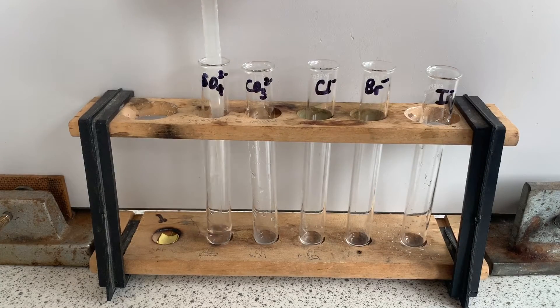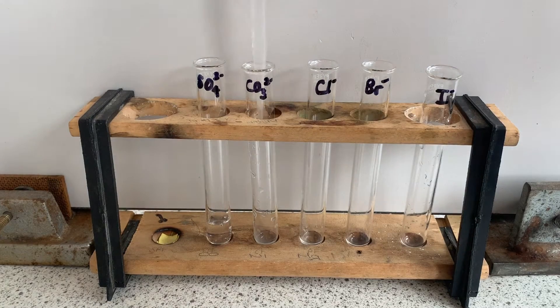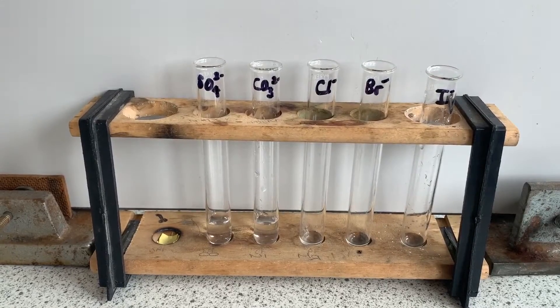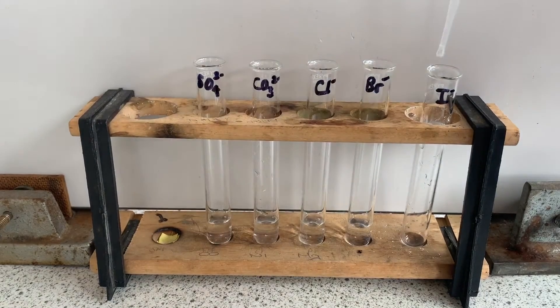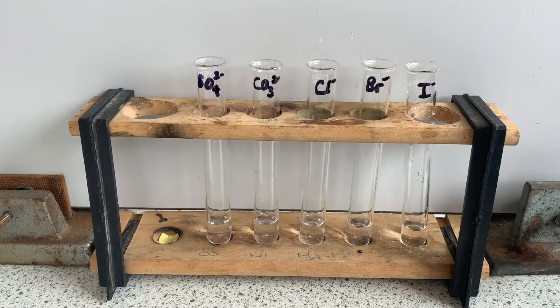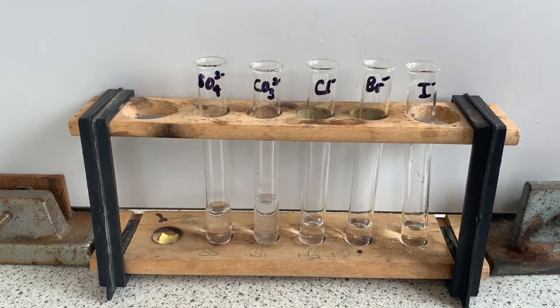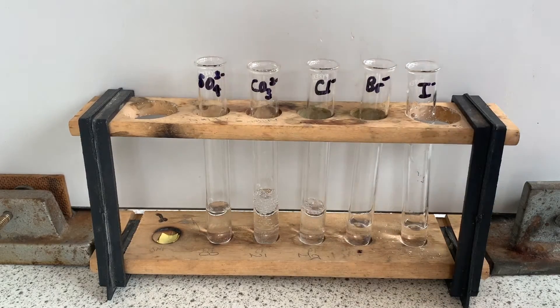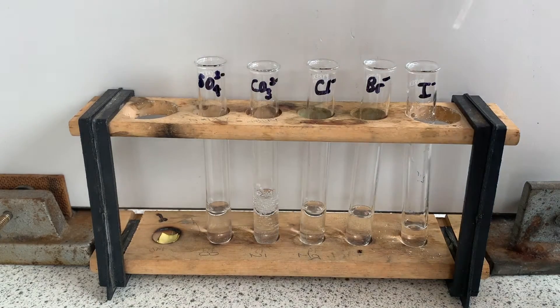First of all I'm adding about a one centimeter depth of each solution into the appropriate test tube. On the far left I have sodium sulfate, then sodium carbonate, then sodium chloride, sodium bromide and sodium iodide. I've labelled my test tubes with the non-metal ion. Now I'm going to add about another one centimeter depth of the dilute hydrochloric acid. In sodium sulfate there is no fizzing. However in sodium carbonate there is fizzing and that's because carbon dioxide is being given off. In your practical you might use lime water to prove this is carbon dioxide. For the rest of the solutions there is no fizzing because no gas is being given off.